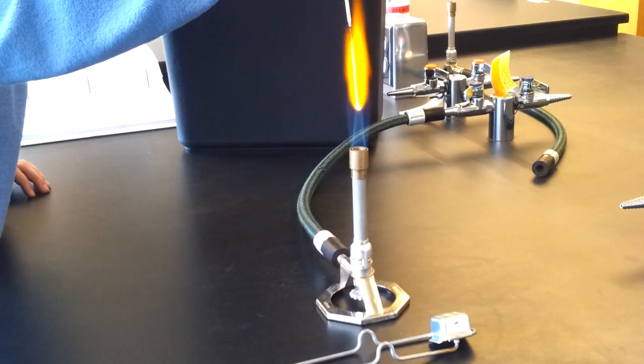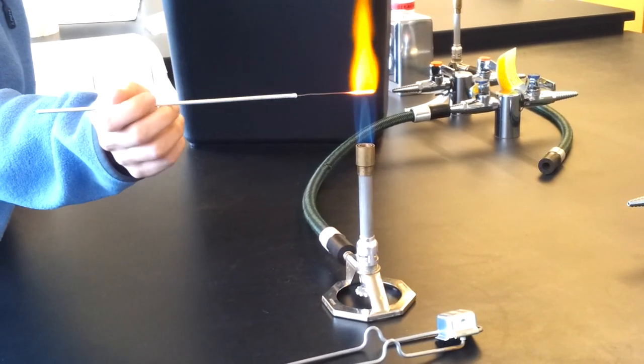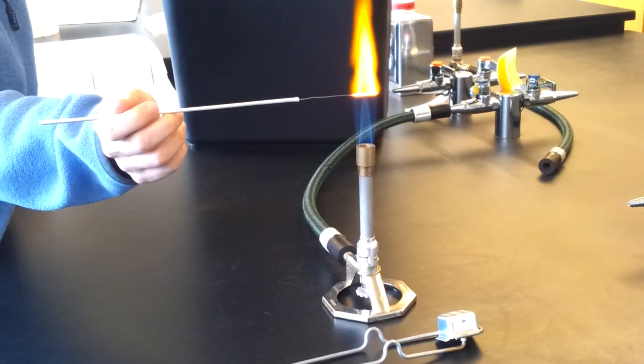If I go too high, I'm going to burn my fingers. If I go, let's say, 3 o'clock, which would be really bad, see how I can't get the whole thing orange?